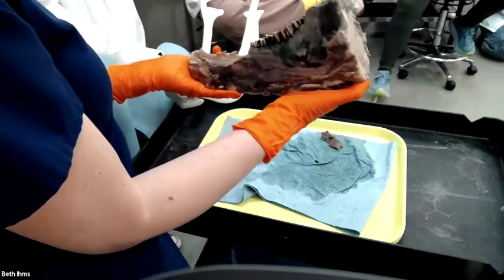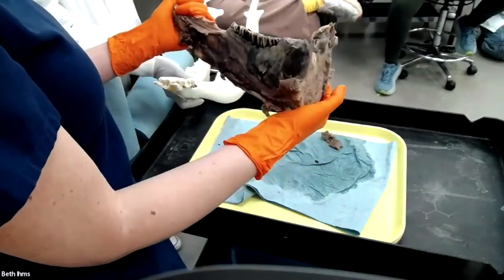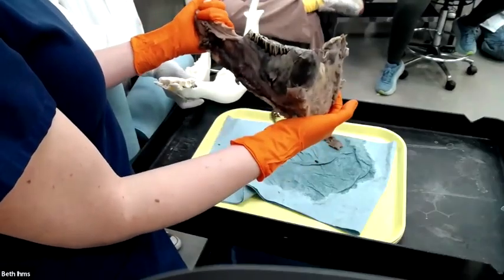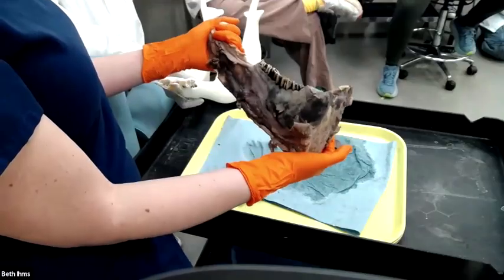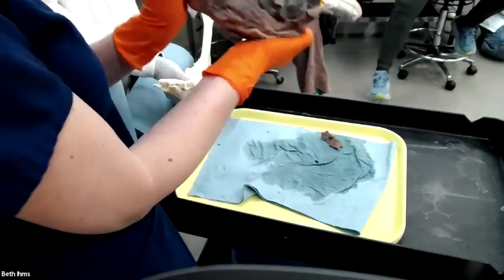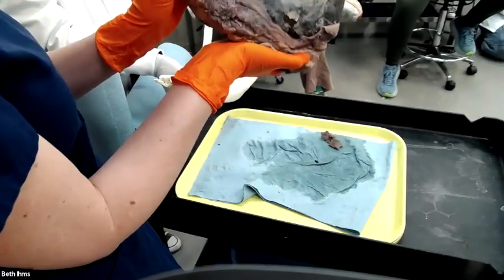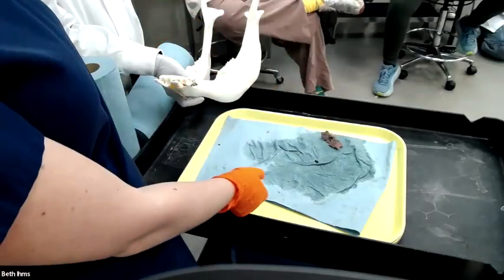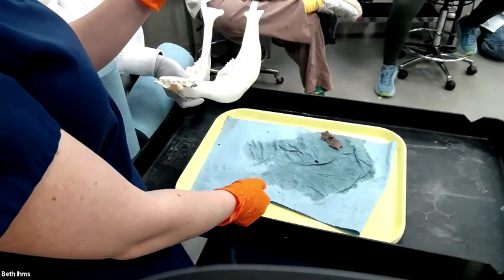Anybody know what this is? This is not an osteosarcoma. This is a food animal. Food animals die from infectious things because we eat them before they get cancer. One of my favorite things about pathology is the way we name things. We often name diseases very descriptively. So if you were going to name this disease based on what I'm holding right here, what would you call this if you were a silly person or a pathologist?